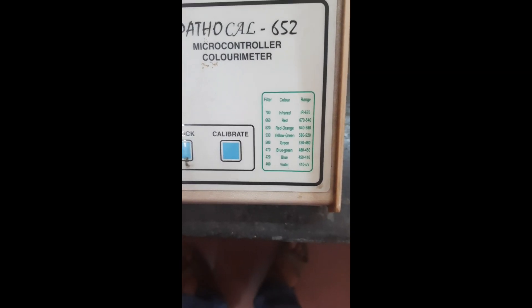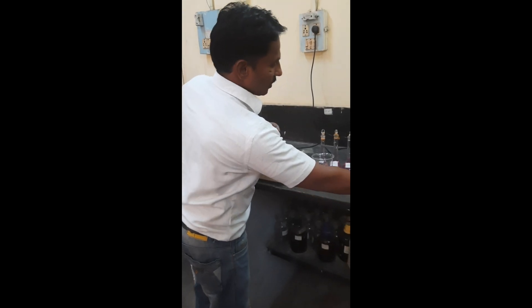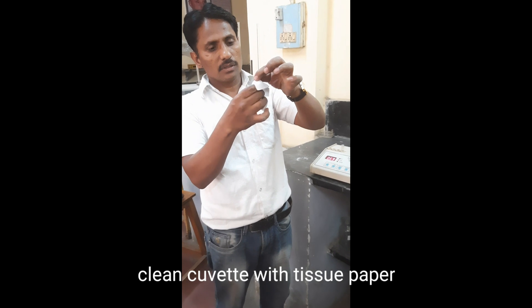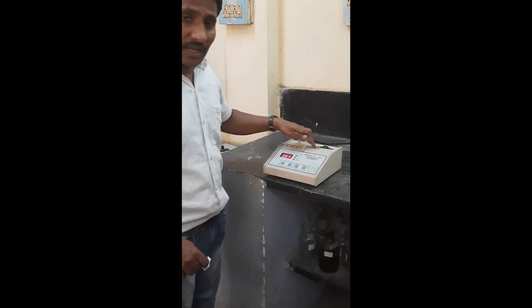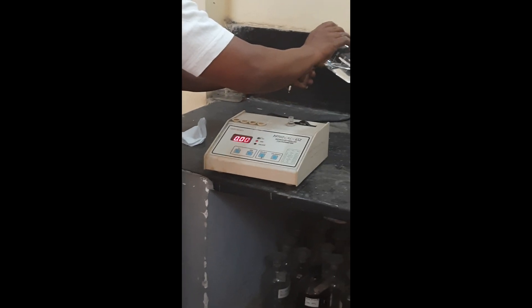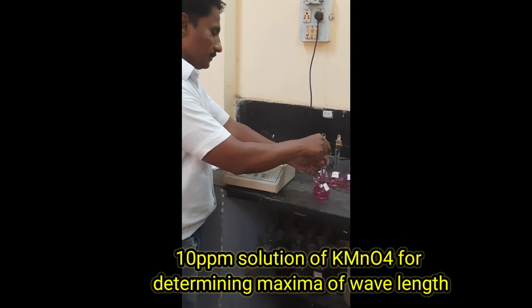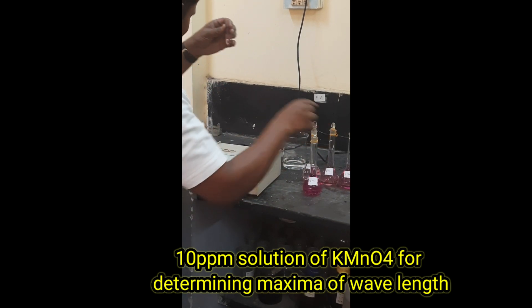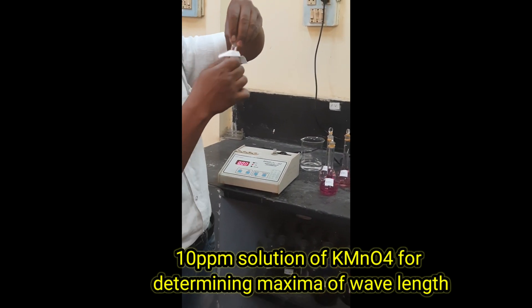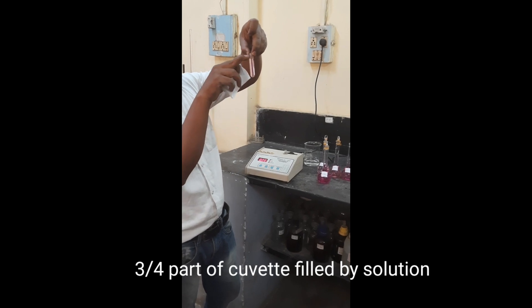By taking distilled water in this cuvette, first clean the cuvette and make it dry, then put it in the sample cell. Then take the KMnO₄ solution — do not completely fill the cuvette, otherwise the cell will be damaged.